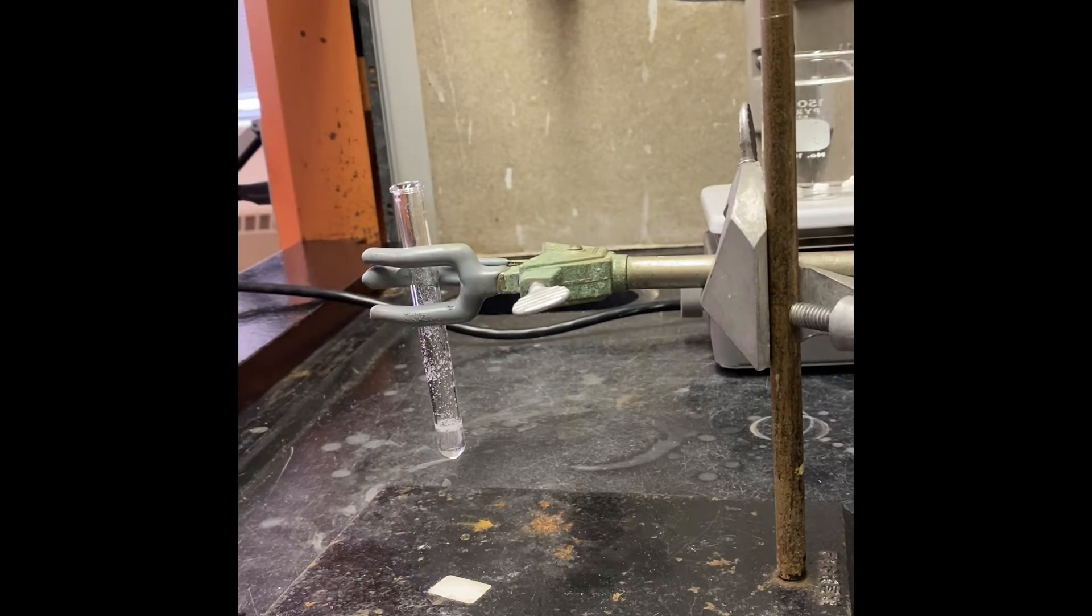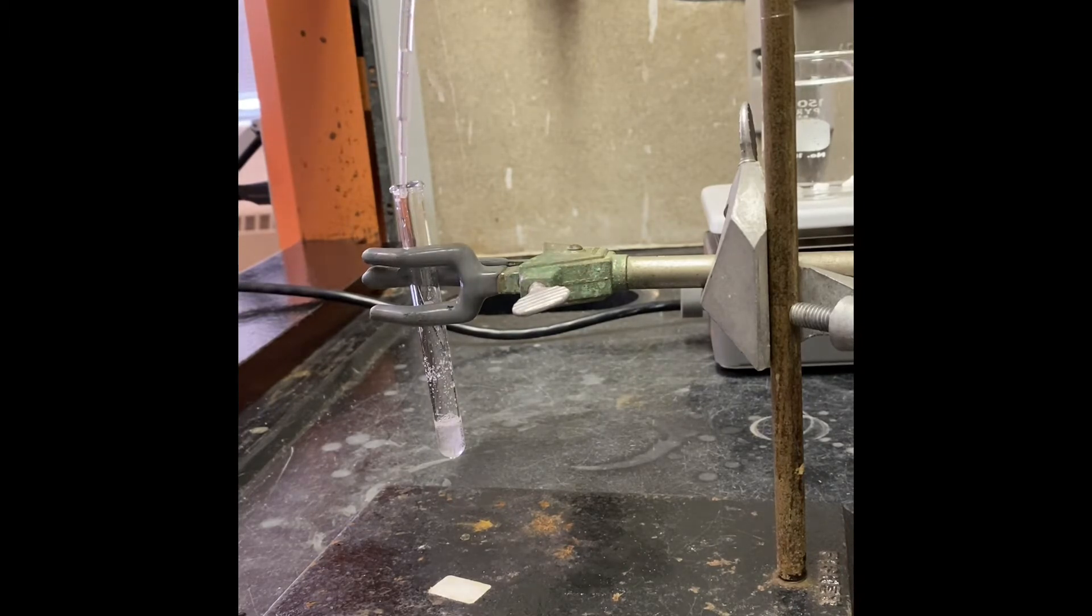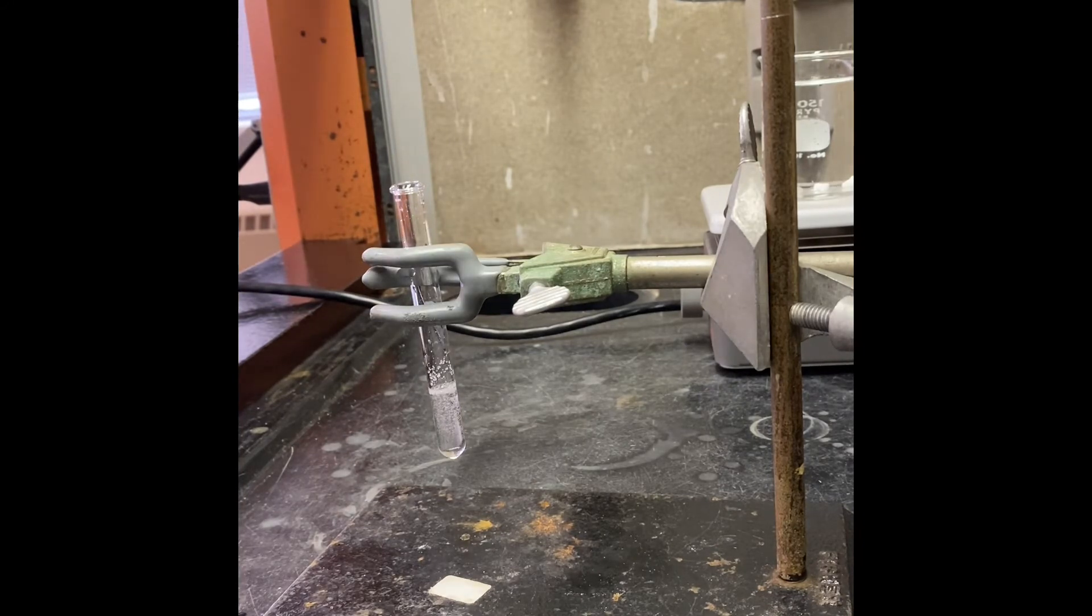It's been 10 minutes, the reaction is complete, so I'm going to add 0.5 milliliters of water slowly. We added 0.5 milliliters of water and now we're going to heat that up to the boiling point.